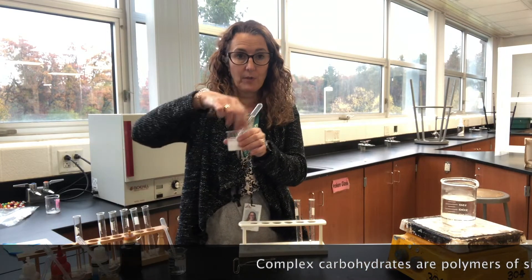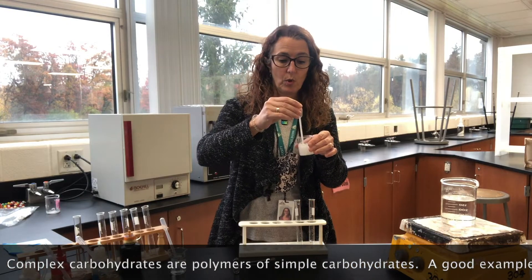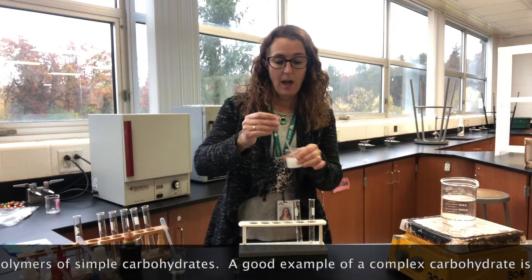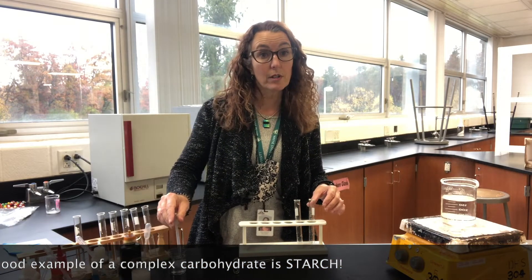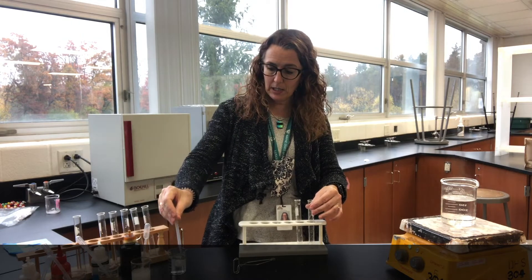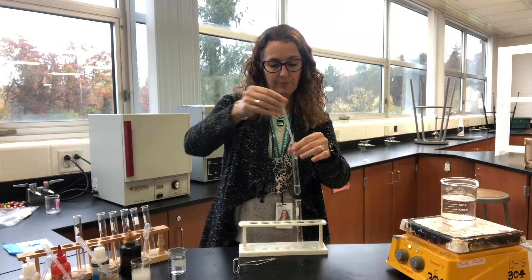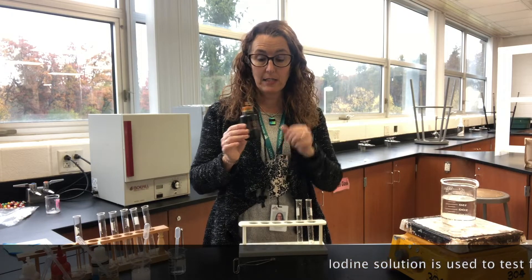I'm going to get some starch. Starch isn't very soluble so I have to give it a stir and put it into my test tube. In the next test tube I'm going to put some water, and the water is going to be a control. I'll make sure they're about equal.